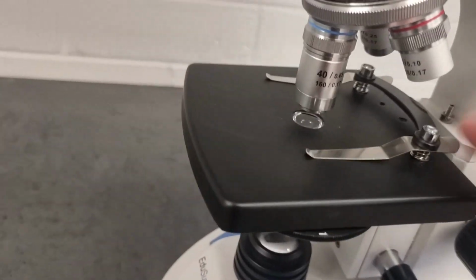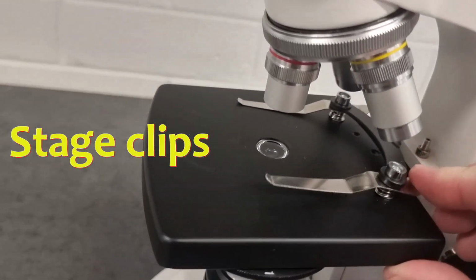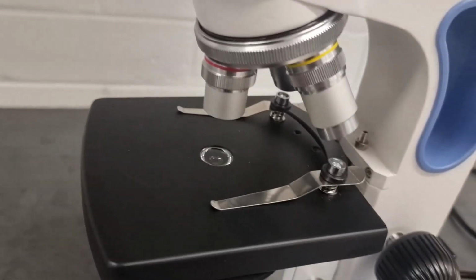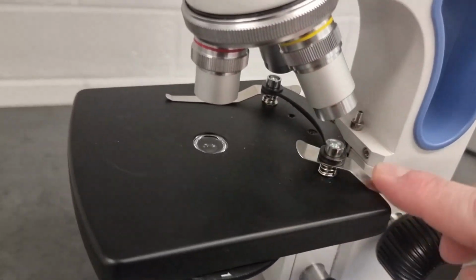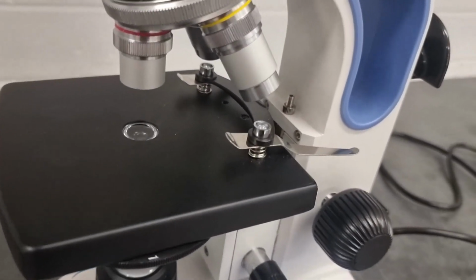Now on the stage we can see these clips here. I'll just move these objective lenses around to make more space so we can see. These clips are what you would put your microscope slide under, to hold the slide in place. That's their job. What I tend to do is get them out of the way. Not just me, a lot of people do this. Just push them to the back, get them out of the way.